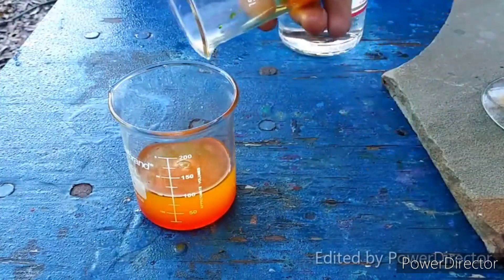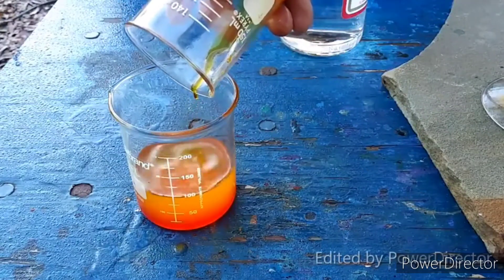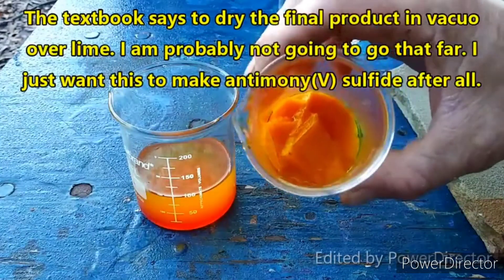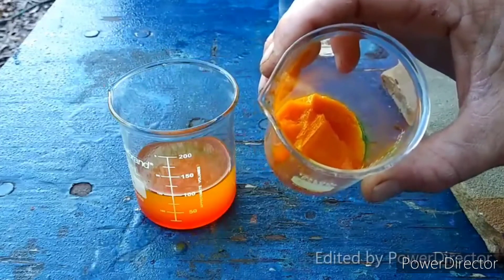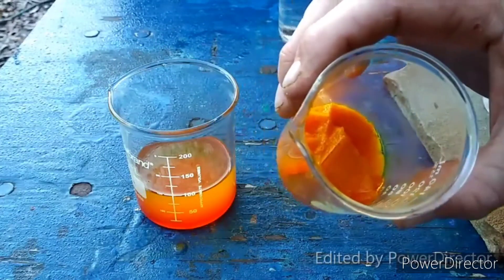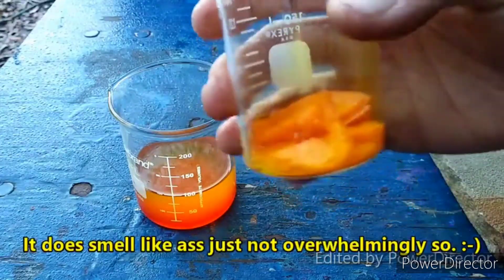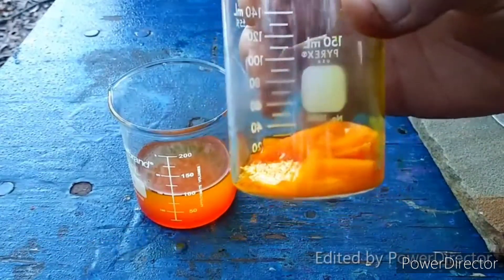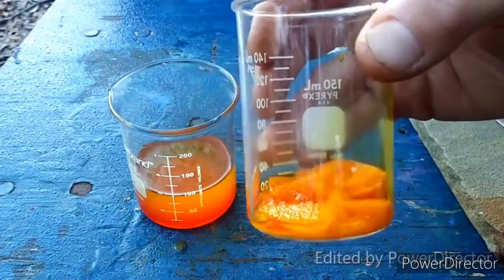Look at it — it's so cool. I don't think I've ever had a product crystallize out where it made such gigantic crystals like that. That is really something else. And what's really funny is that this stuff does not smell that bad. Given everything that went into it, you would think it would smell like ass — and it does smell like a sulfur compound — but it is not that bad. That's cool as fuck, man. I love it.